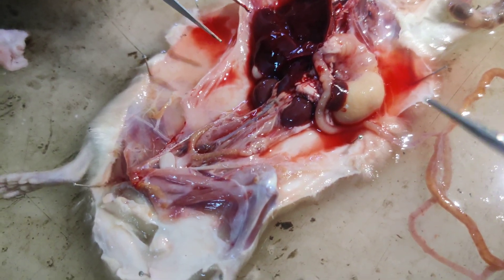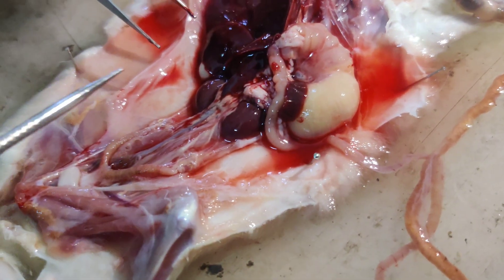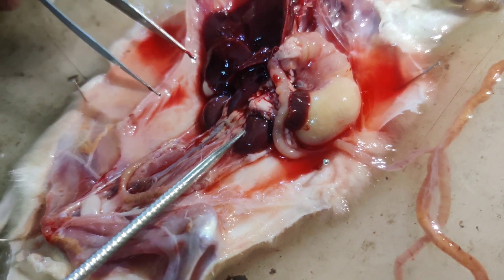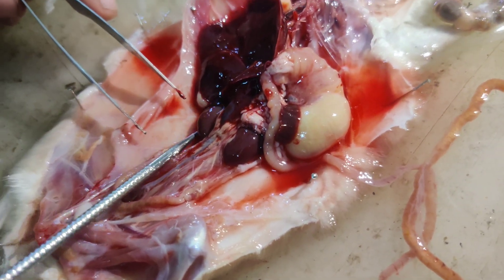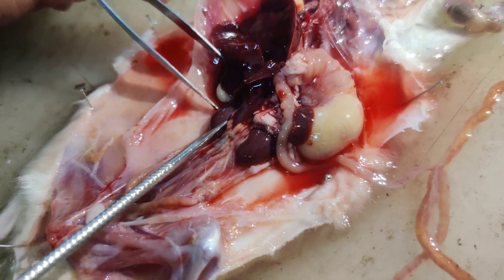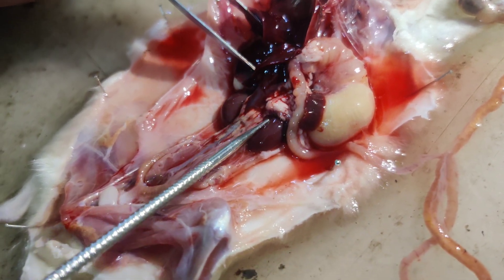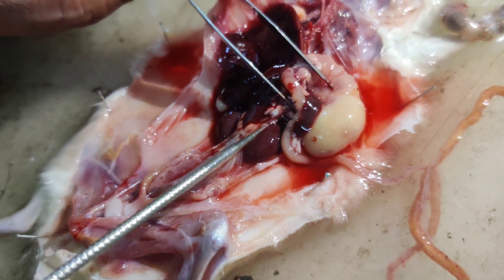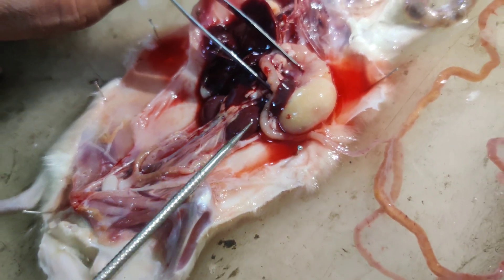Now see the two kidneys. This is the right kidney and this is the left kidney. The position of the right kidney is somewhat towards the upper side, and the left kidney is somewhat towards the lower side. They are bean-shaped.